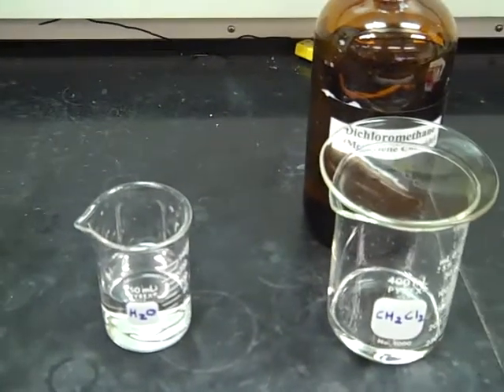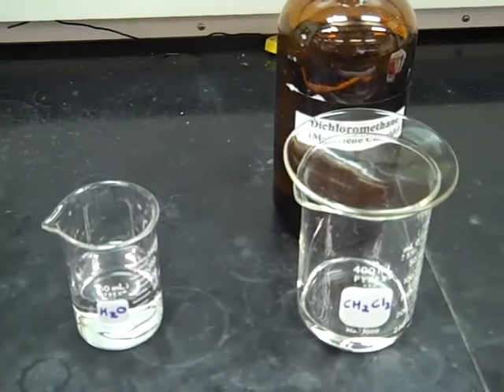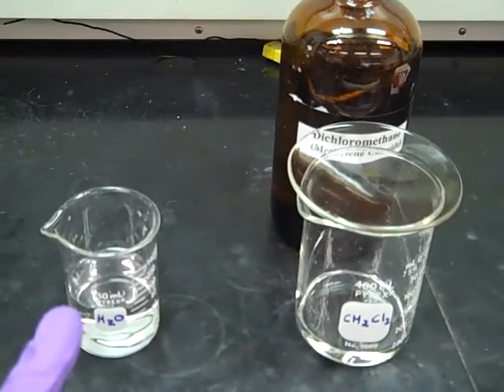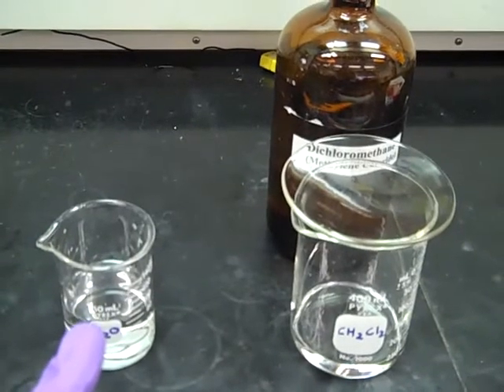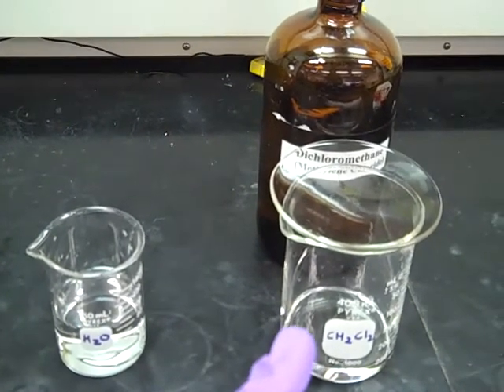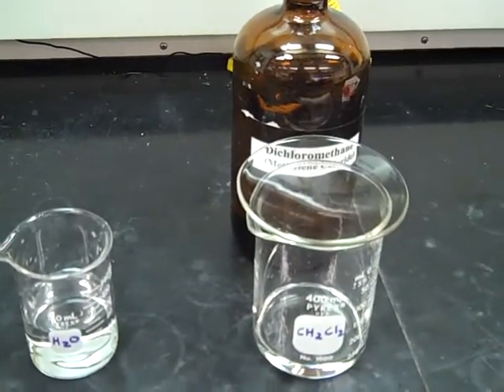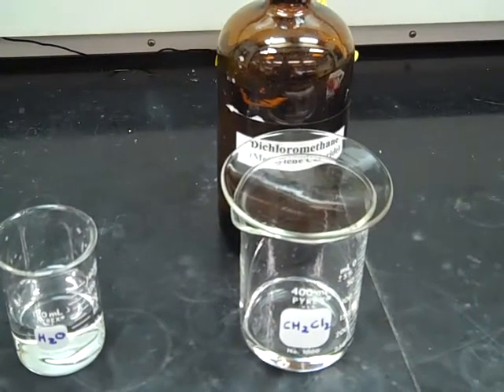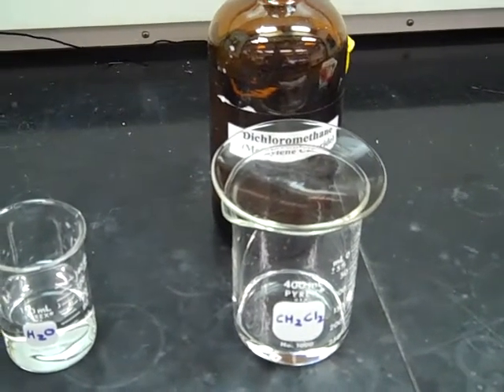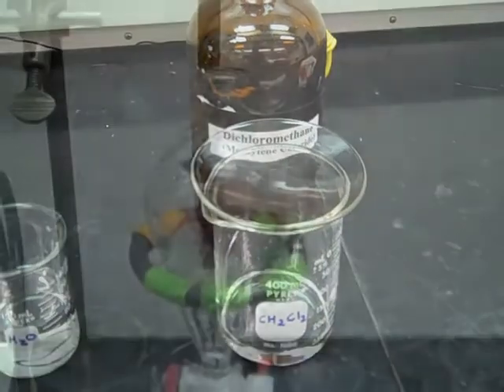So that's the idea behind the separatory funnel. We want things to go between the organic layer and the aqueous layer, so ultimately we can get our organic product maybe more pure than it was to start with in that organic layer. So let's get started on using the separatory funnel.